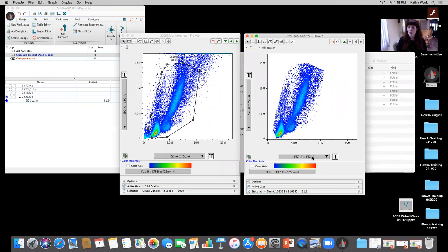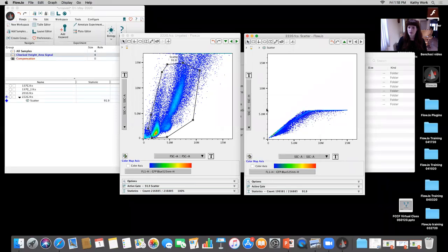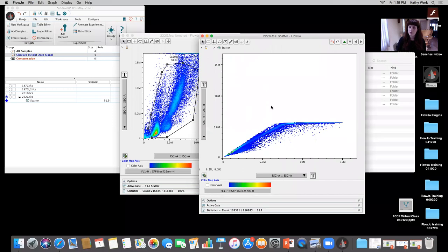And here, I want to next gate on my single cells. So if I come here, we can look at side scatter area on the x-axis and side scatter height on the y. And I need to be able to accurately determine by looking at height versus area where my single cells are. I am immediately running into a problem here, because how can I accurately gate where my single cells are? Typically what you want to see is a population where the height and the area are proportional to each other for single cells. And as two cells go through together at the same time, you have a higher area or width than you do height.